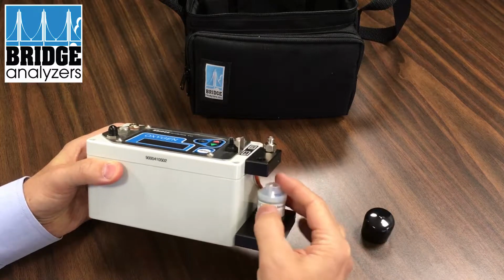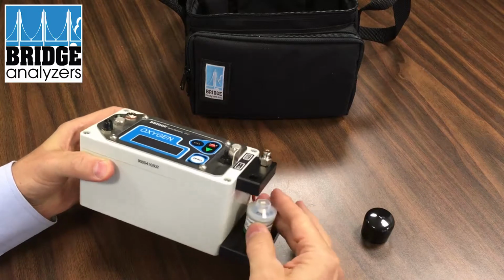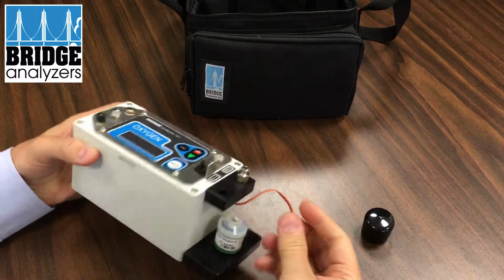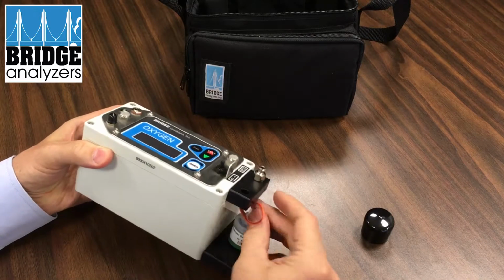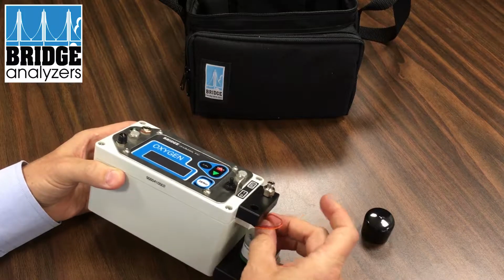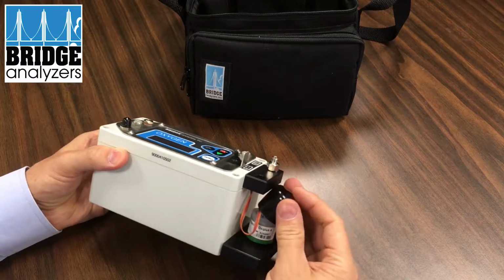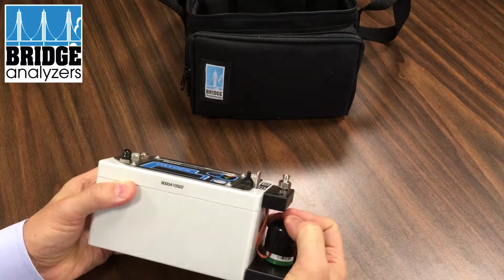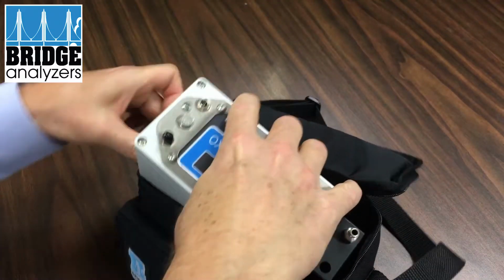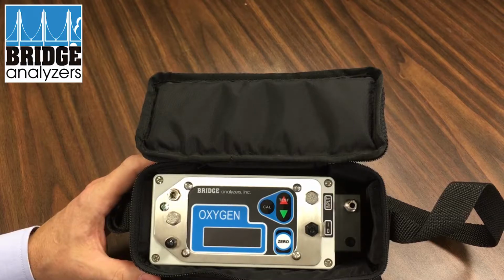You then get your new sensor, screw it in, just snug with your fingers, and then the connector goes back on and it's keyed, so there's only one way to put it on. Plugs in like so. You replace the black cap, return it to the case, and you're ready to operate.